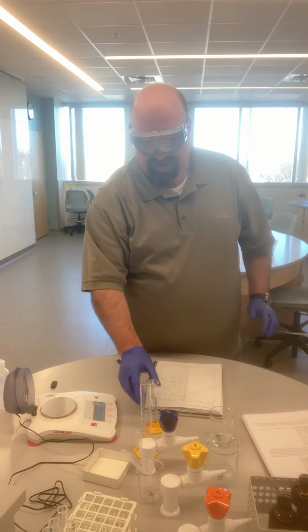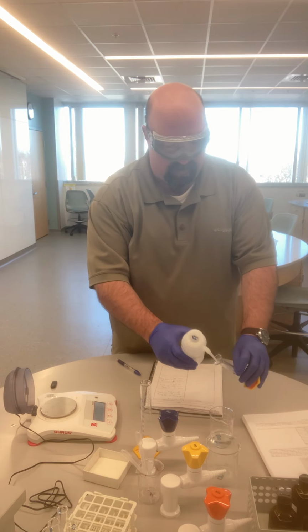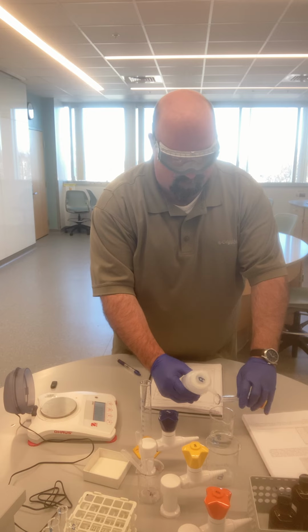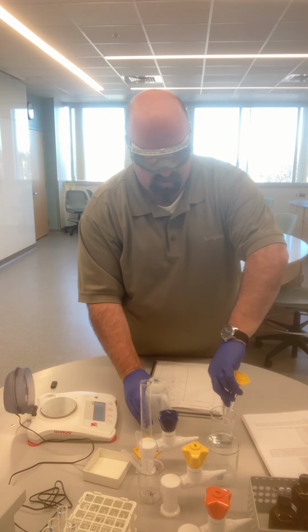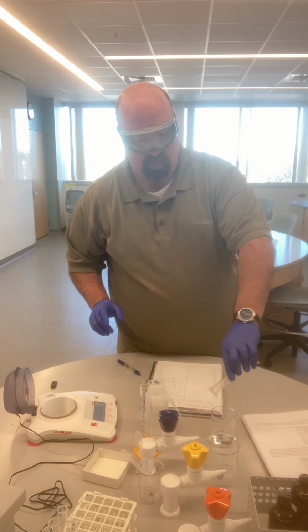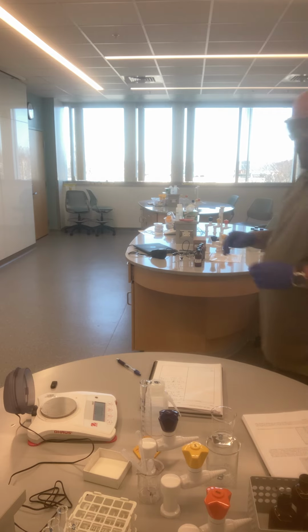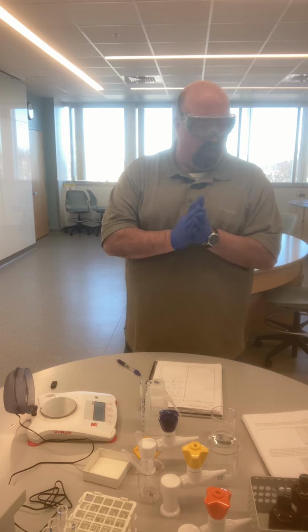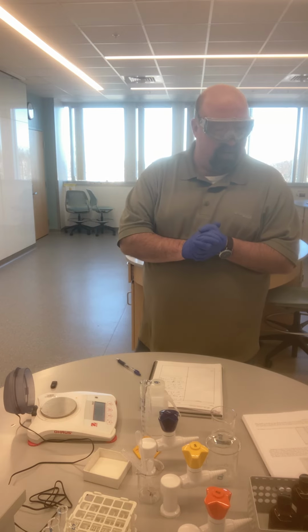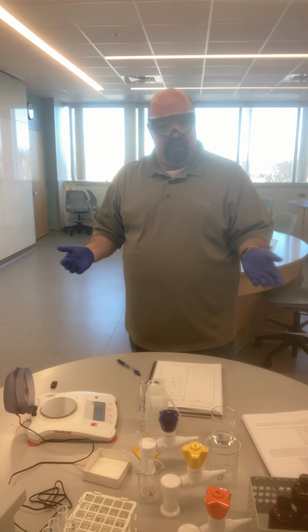And again, all of this data will be provided for you. You can certainly write it down as I go. I will try to announce the data as I do these experiments this semester. But if I forget, or if you miss something, all of the data will be provided in a spreadsheet for you. And so that gives us the mass and the volume information that we need for the densities of our liquids. We now need to find the densities of our solids.